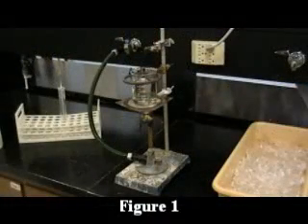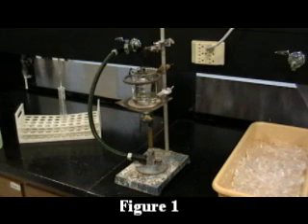Before continuing with the experiment, you will need to set up the apparatus as shown in Figure 1. Begin by clamping a ring clamp to a ring stand and place a piece of wire gauze on the ring clamp.